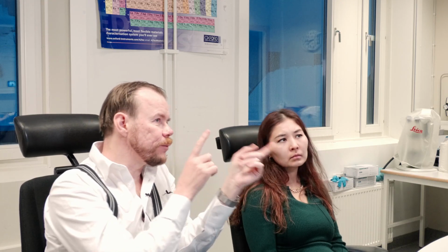So if you go from process time 1 to process time 6, you can see a little bit of improvement. But from a practical aspect, you can just use process time as a way to adjust the dead time. You will not get any resolution performance boost on these modern detectors.